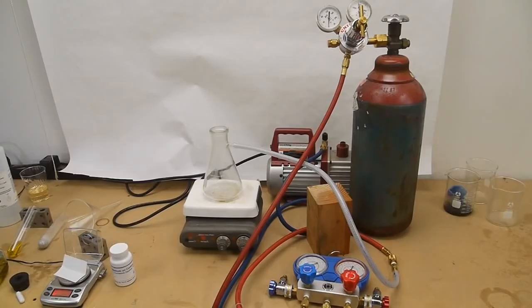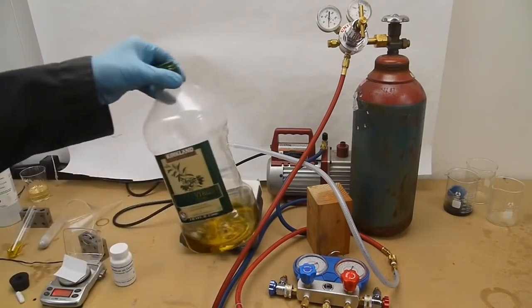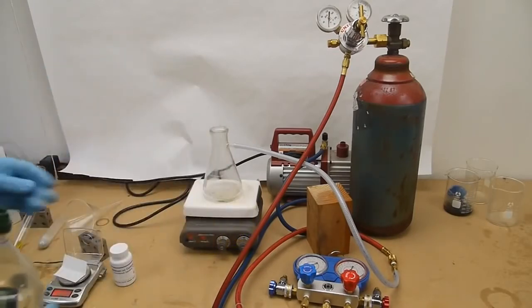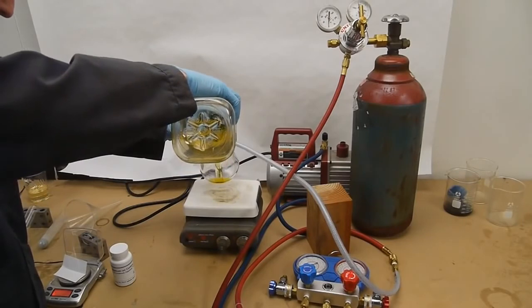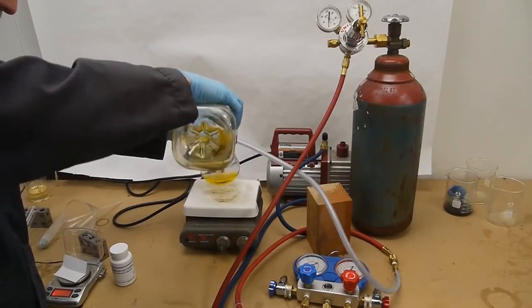In our quest to make better tasting food, we figured out we could take an already pretty good tasting oil and add hydrogen gas to create an even more desirable saturated fat. What I'm going to do today is saturate a little bit of olive oil to show you the process. Since this is not a quantitative analysis, I'm just going to measure stuff out kind of by eye.